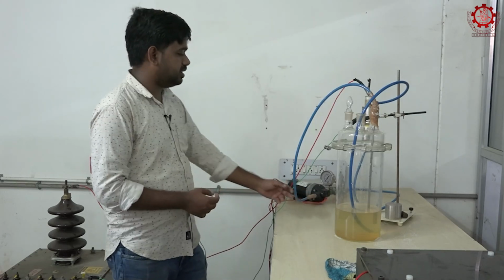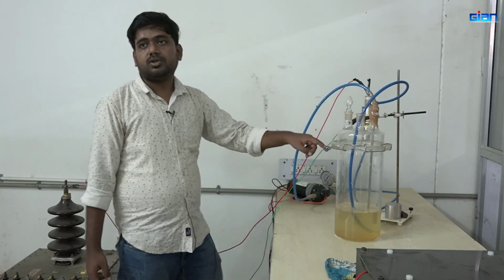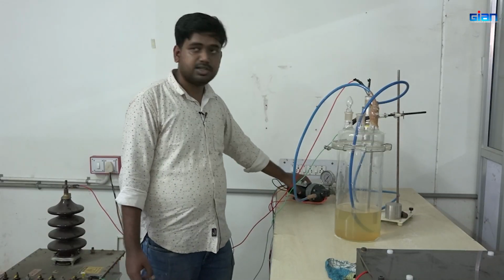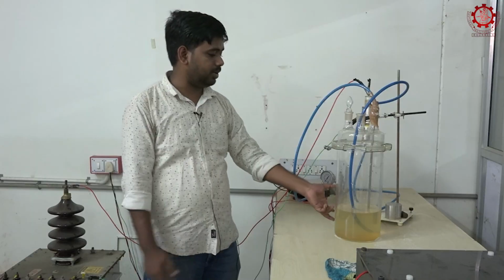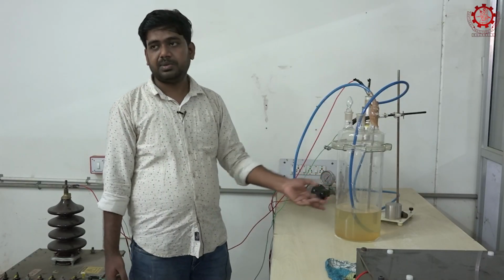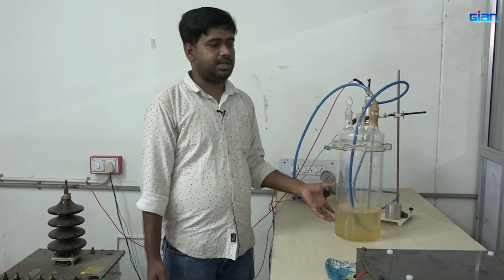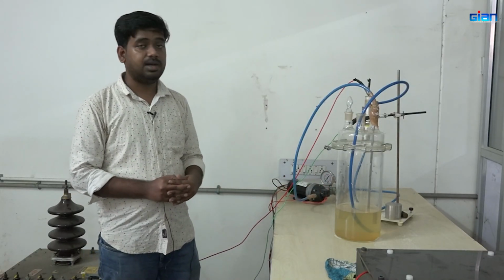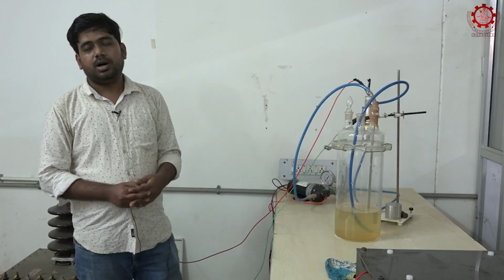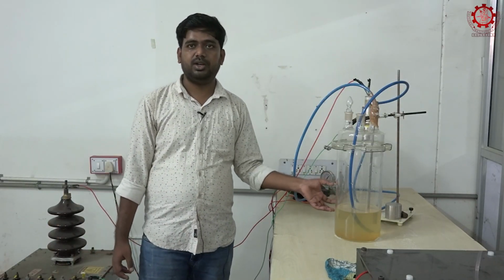For this condition we want to note that the pressure value and the duration are also important, because if the pressure is not sufficient, it will not create a sufficient amount of plasma activated water. But the limitation of plasma activated water is its short shelf life, or you can say short stability. Here the maximum retention time for the plasma activated water is up to 30 minutes. So for longer processing times, as of now the plasma activated water may not be suitable.